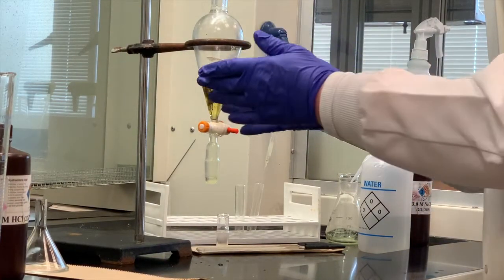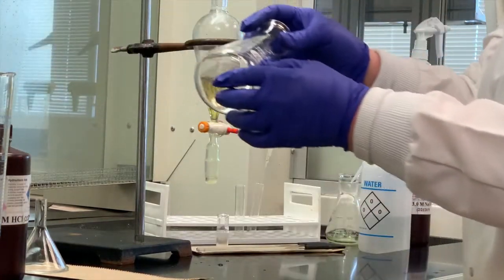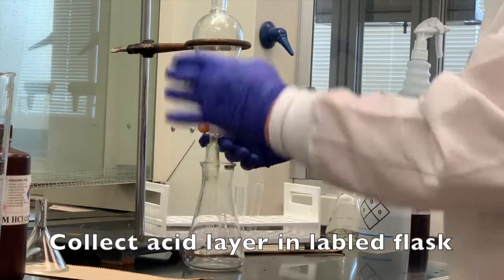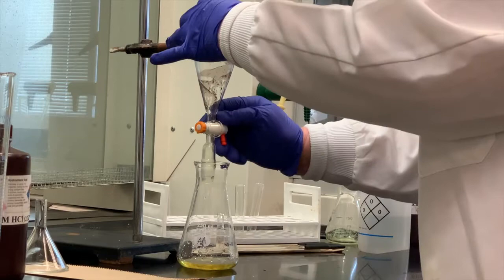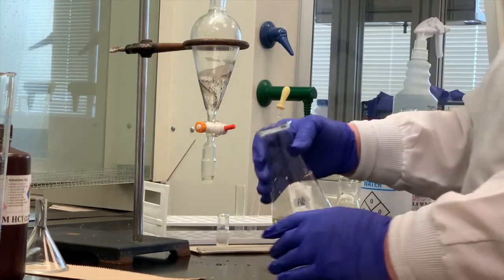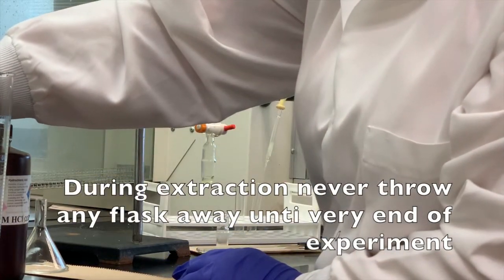Now remember, what did we put in here is acid. So I'm going to use the flask that says aqueous A, which stands for the aqueous acidic layer. So now what I'm going to do is drain the rest of that. Alright, this is my aqueous acid. So I'm going to set it aside, and remember, never throw any flask away.